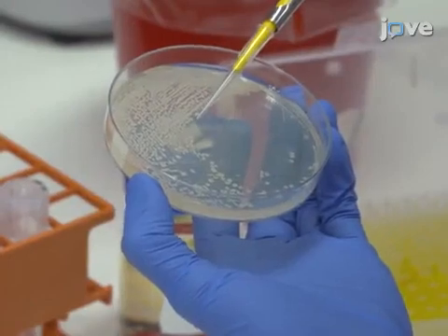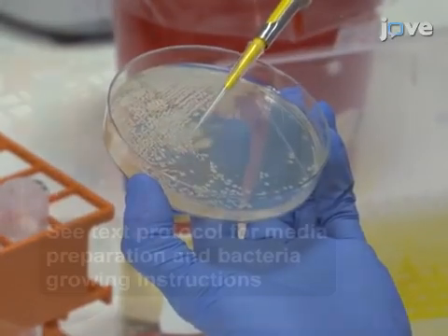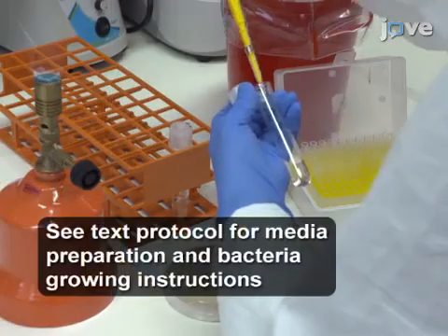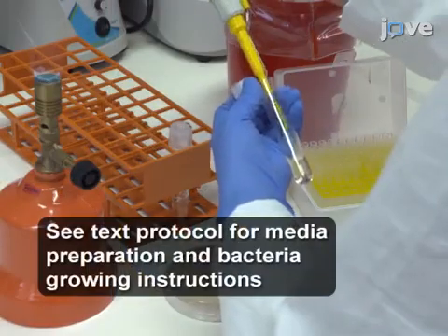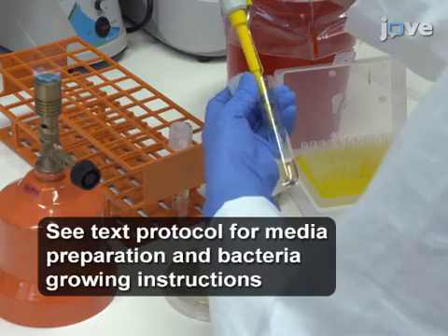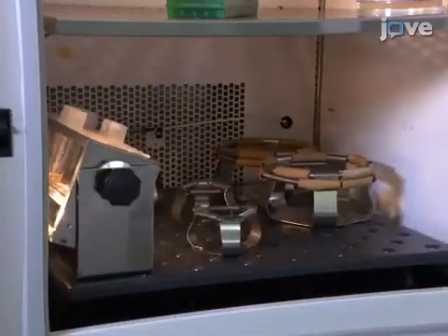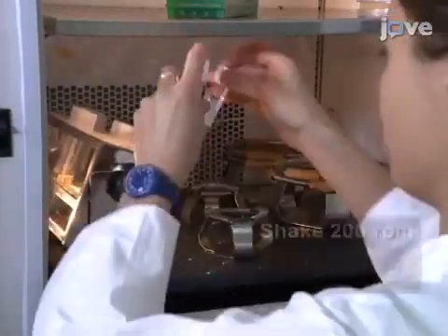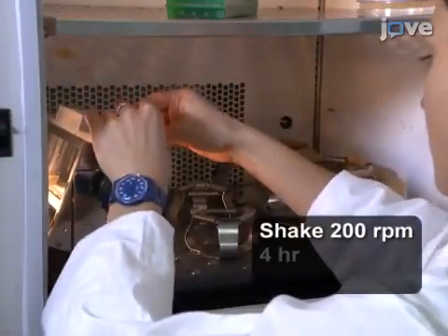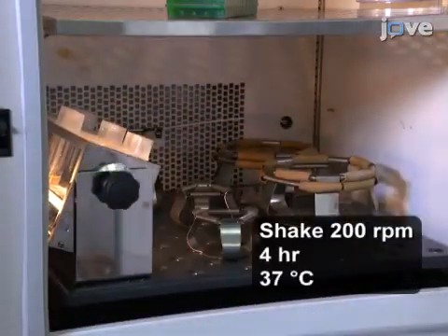To begin, first select an appropriate single colony and transfer it into three milliliters of LB broth. Place this starter culture into a shaking incubator for four hours at 37 degrees Celsius.